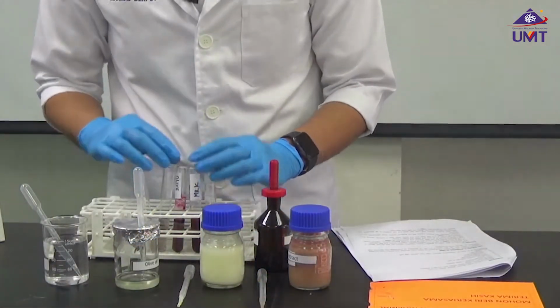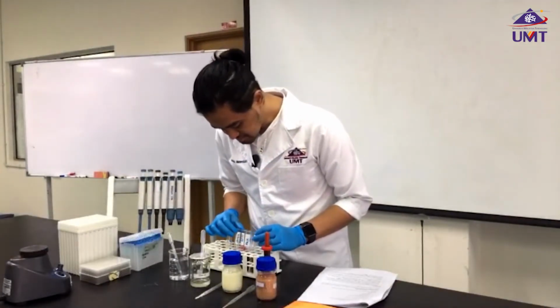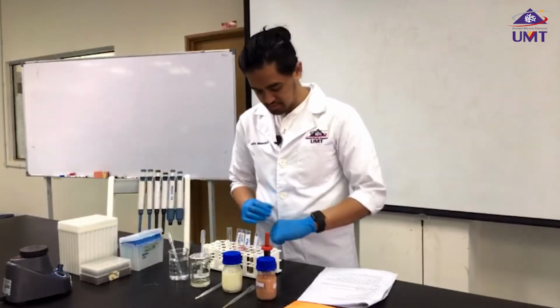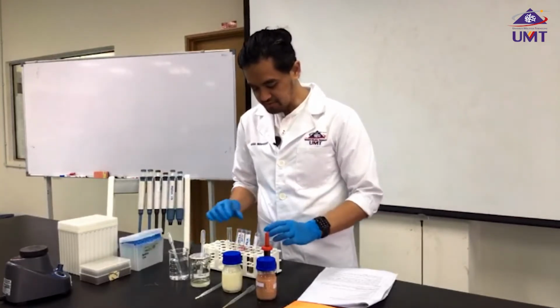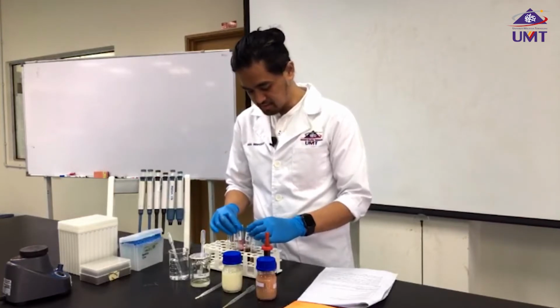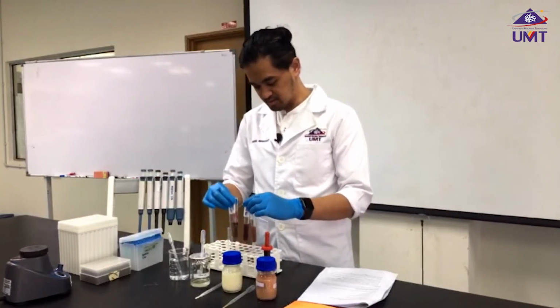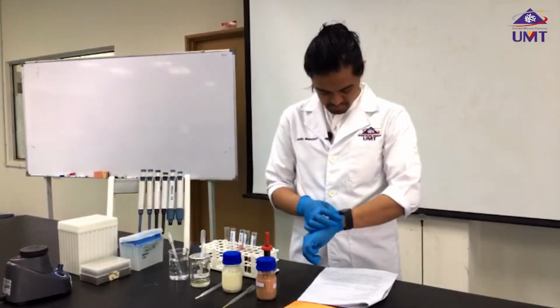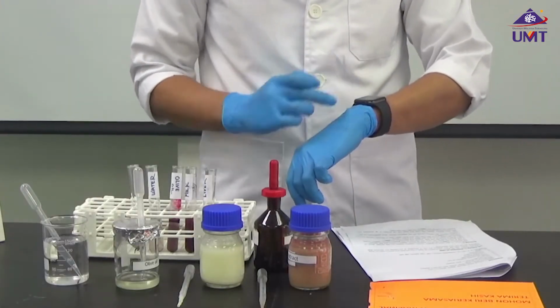I will leave it for 5 minutes. Okay? And after 5 minutes, I'm going to shake this again, and then we're going to see what happens after 5 minutes. I'll come back to that.